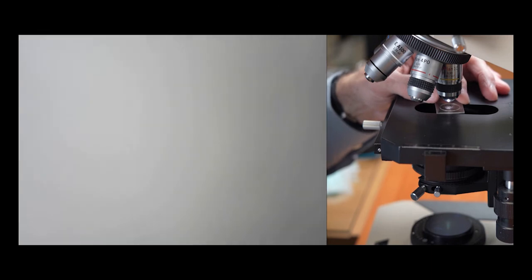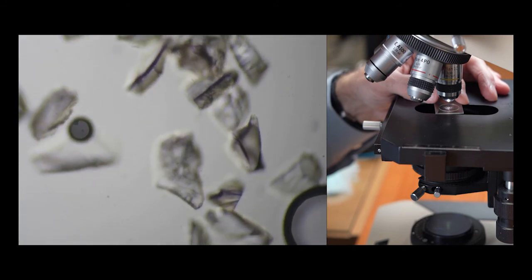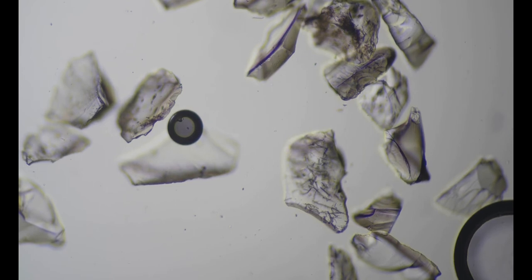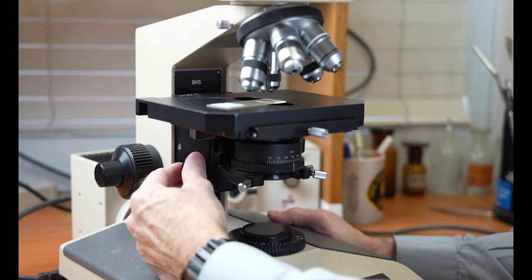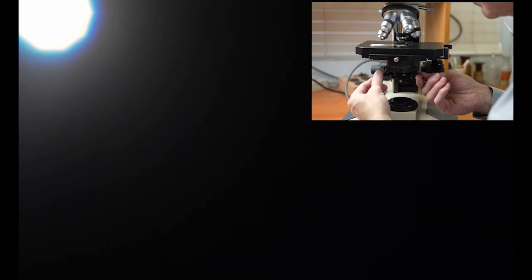As you focus slowly onto the specimen, move the slide back and forth slightly to more easily see where your sample is. This sample has moderately heavy contrast and is easy to see, but a less contrasted specimen may be more difficult. Without touching the focus, move the slide to a clear area through the mounting media and under the cover slip. Reduce the field diaphragm to its minimum opening. Using the condenser focusing knob, use the condenser to focus the leaves of the field diaphragm in the field of view. Use the centering knobs on the condenser to move the condenser so the field diaphragm is in the center of the field of view.